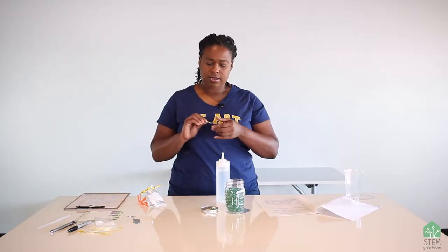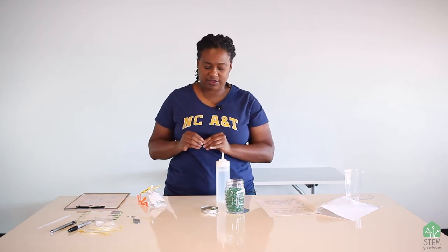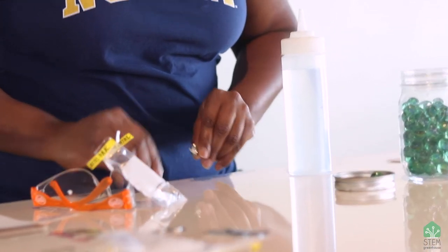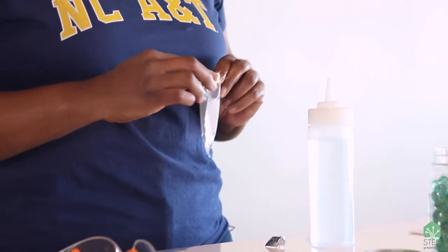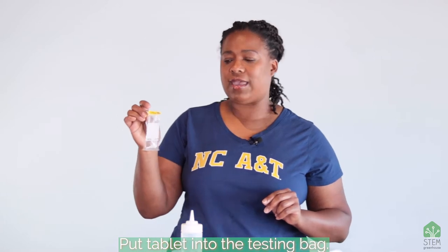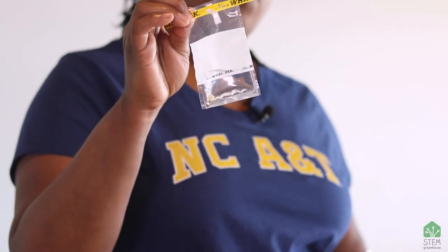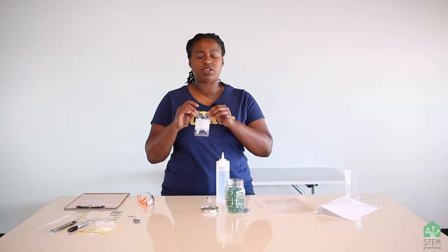Now I'm going to take the indicator — this is the one for iron. We're going to do iron first. You will get the iron tablet; I'm using two but just use one right now. Some of these tablets are more delicate than others, so you have to be careful when taking them out so you don't break them up too much. Put the tablet in the baggie. The iron tablet takes a while to dissolve — some dissolve really quickly, but the iron tablet actually takes a minute. You might want to allow it to just sit in the water for a minute before you start shaking it.